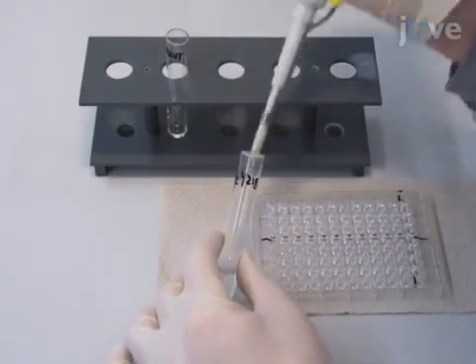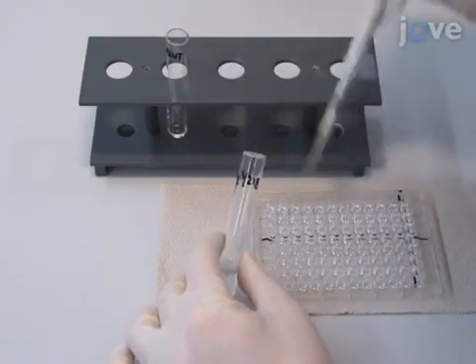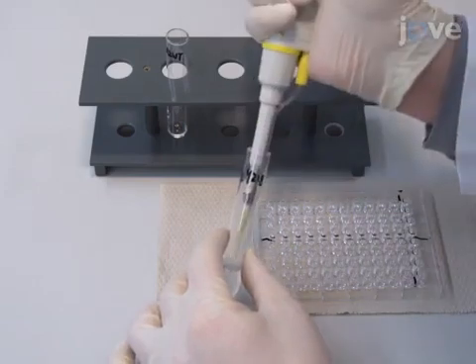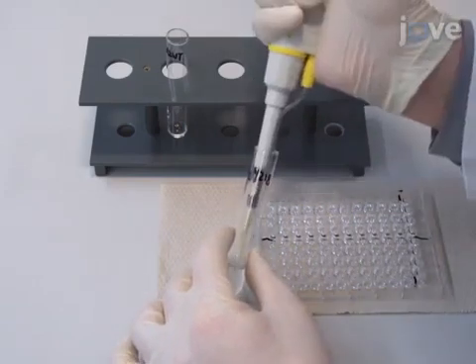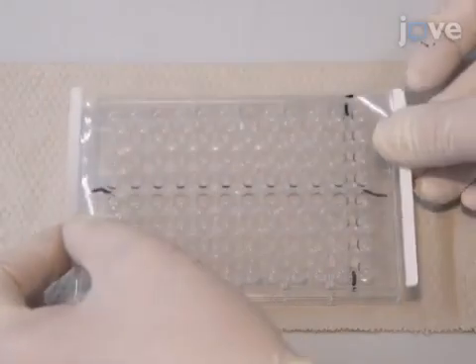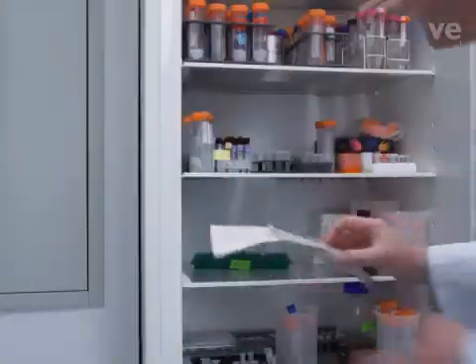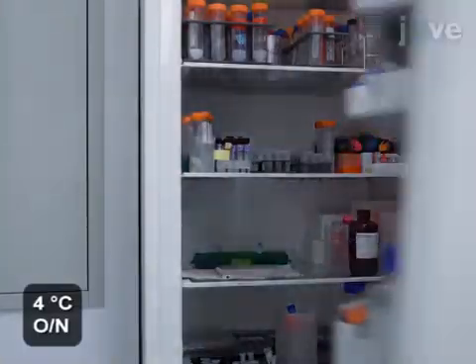Perform every titration row at least in duplicates. In this example, every titration row is performed in quadruplets. Seal the plate with foil and leave the plate at 4 degrees Celsius overnight.